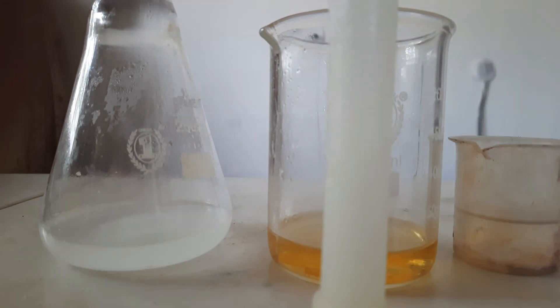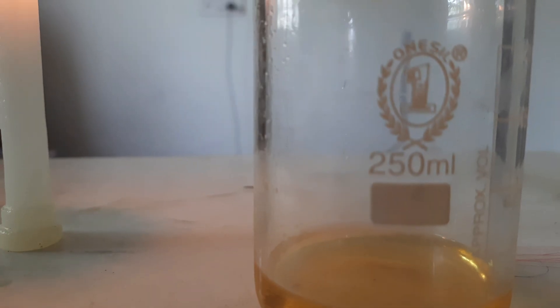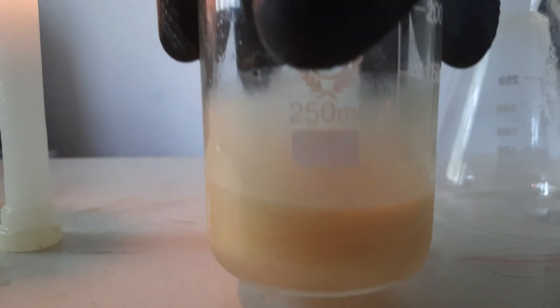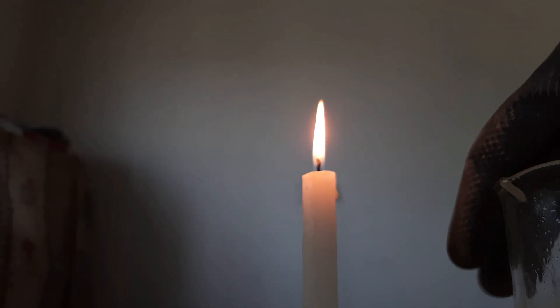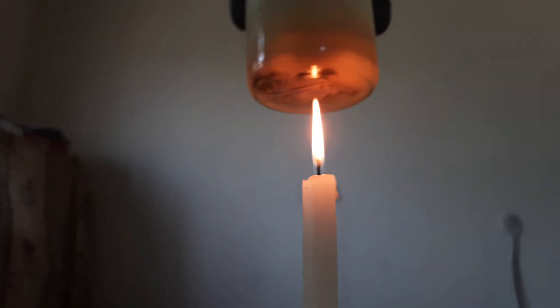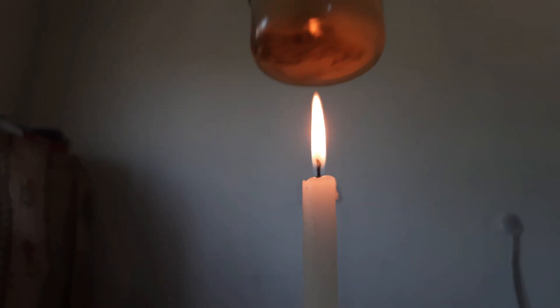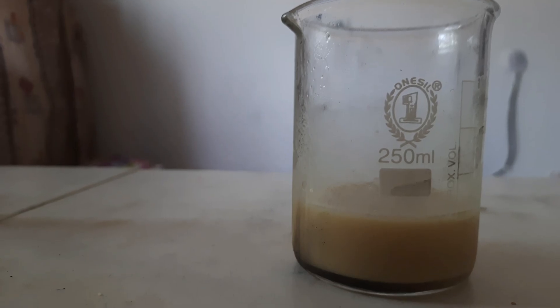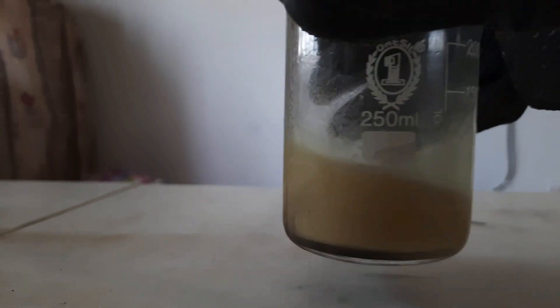I'm using a candle as a heating source since I'm a starter. First, pour in your sodium hydroxide solution — it starts to precipitate into soap and glycerol right away. For better results, I recommend heating up to 50 to 60 degrees Celsius with continuous stirring. Once the solution reaches 50 to 60 degrees Celsius, blow out the candle.